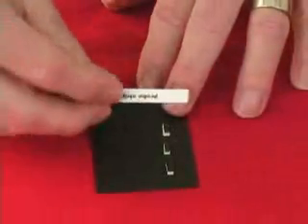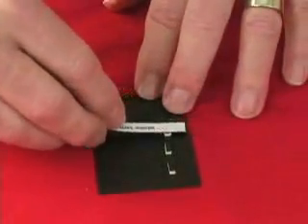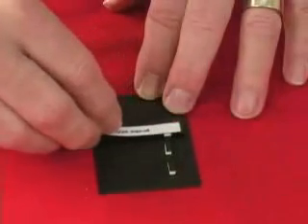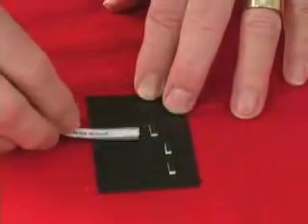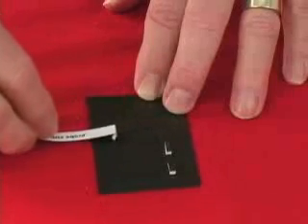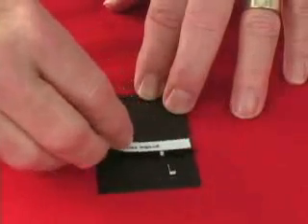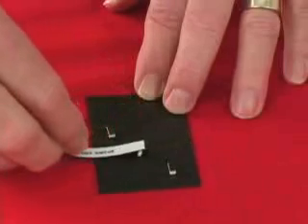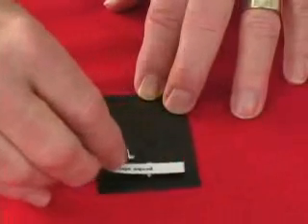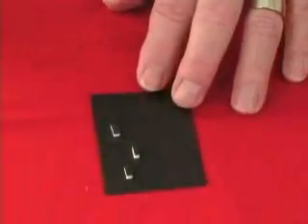Here we have a probe strip, and we're going to emulate what Don Eigler did using pieces of our refrigerator magnet that have pieces of double-stick foam in between the two layers of magnet.